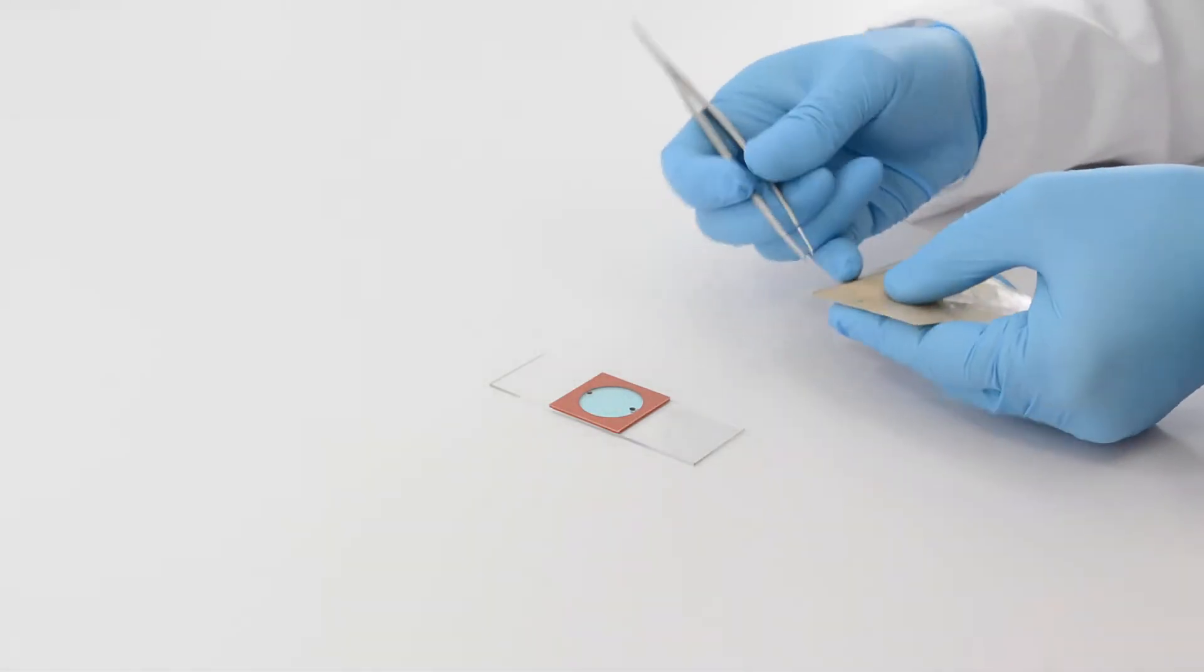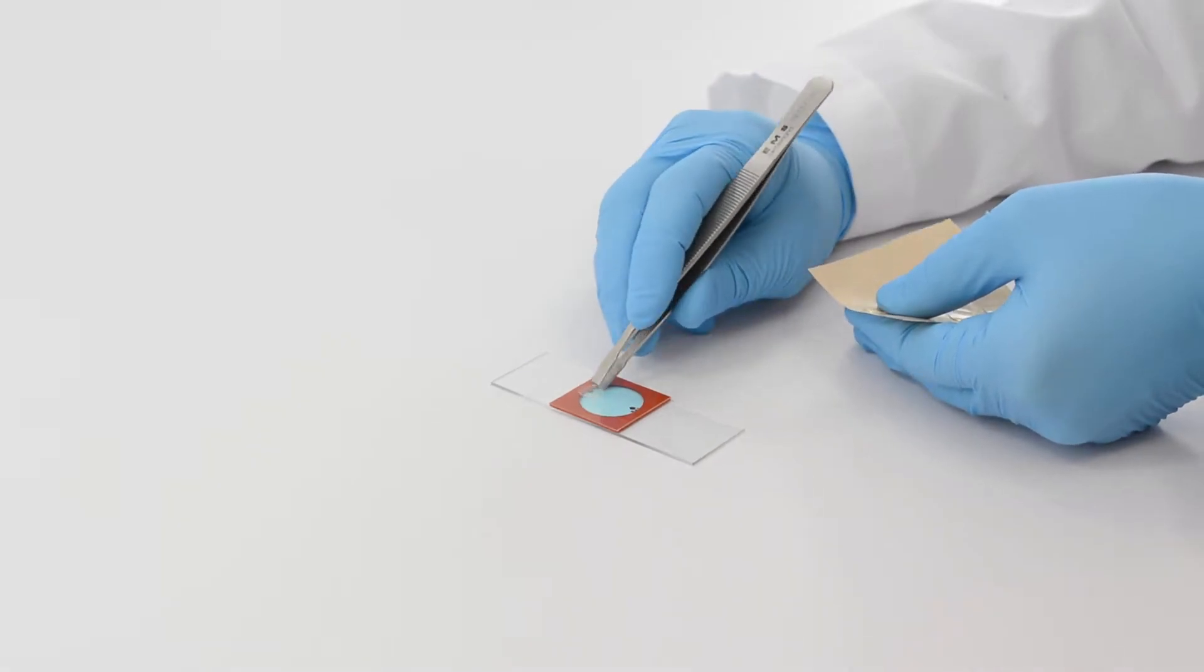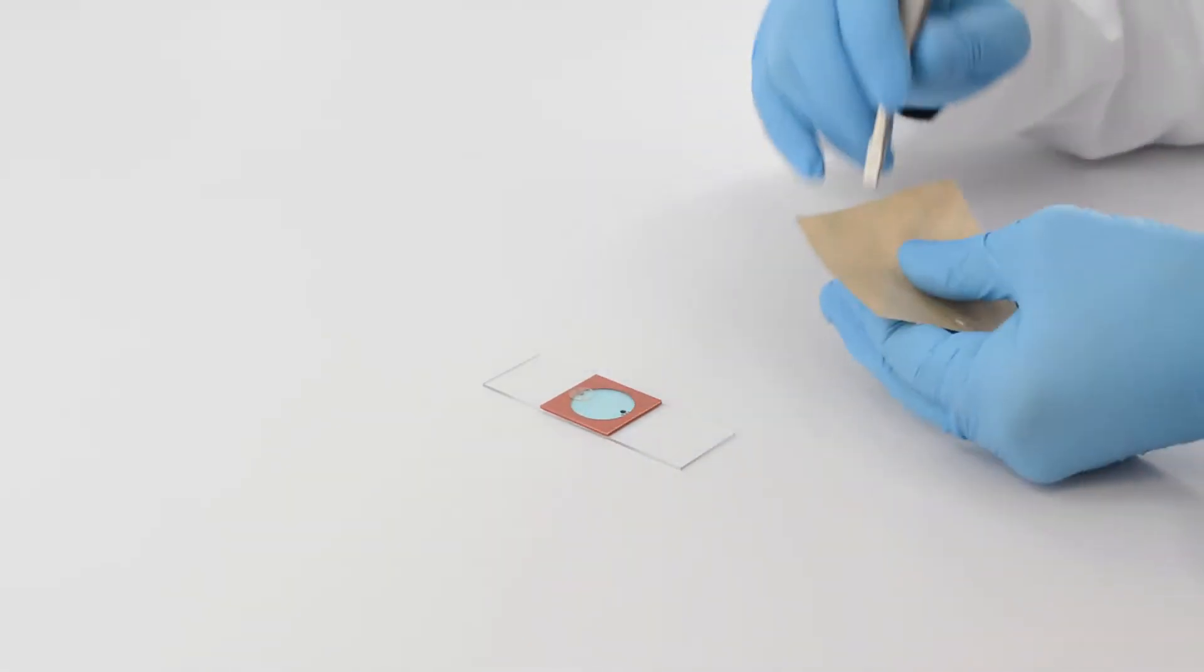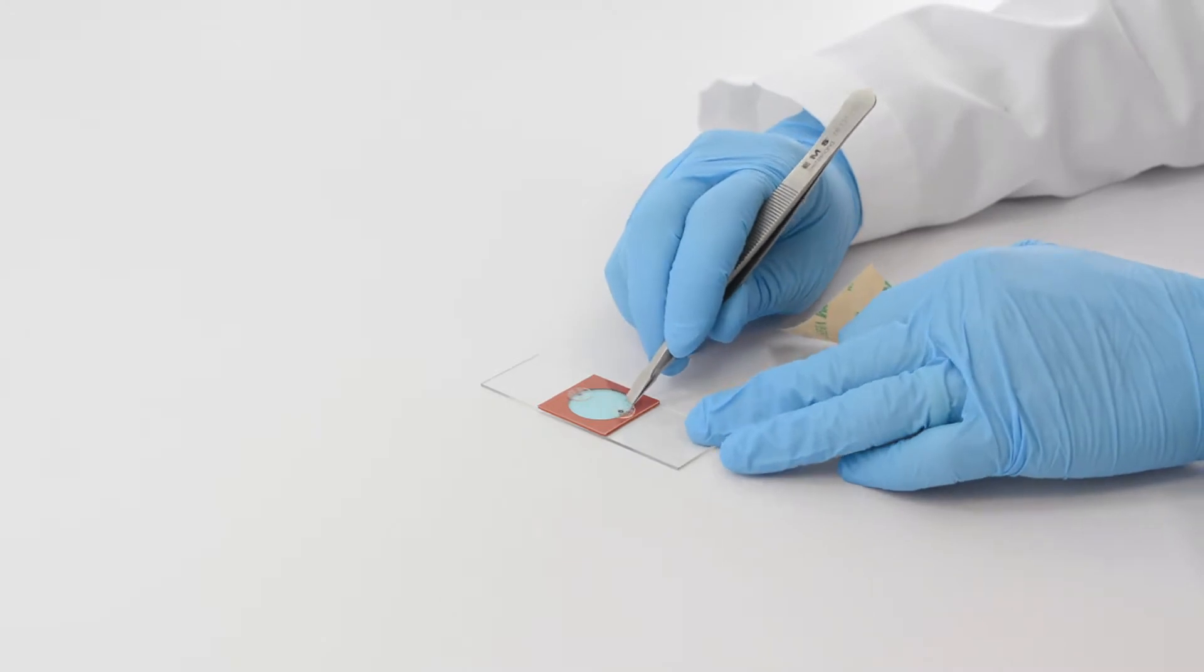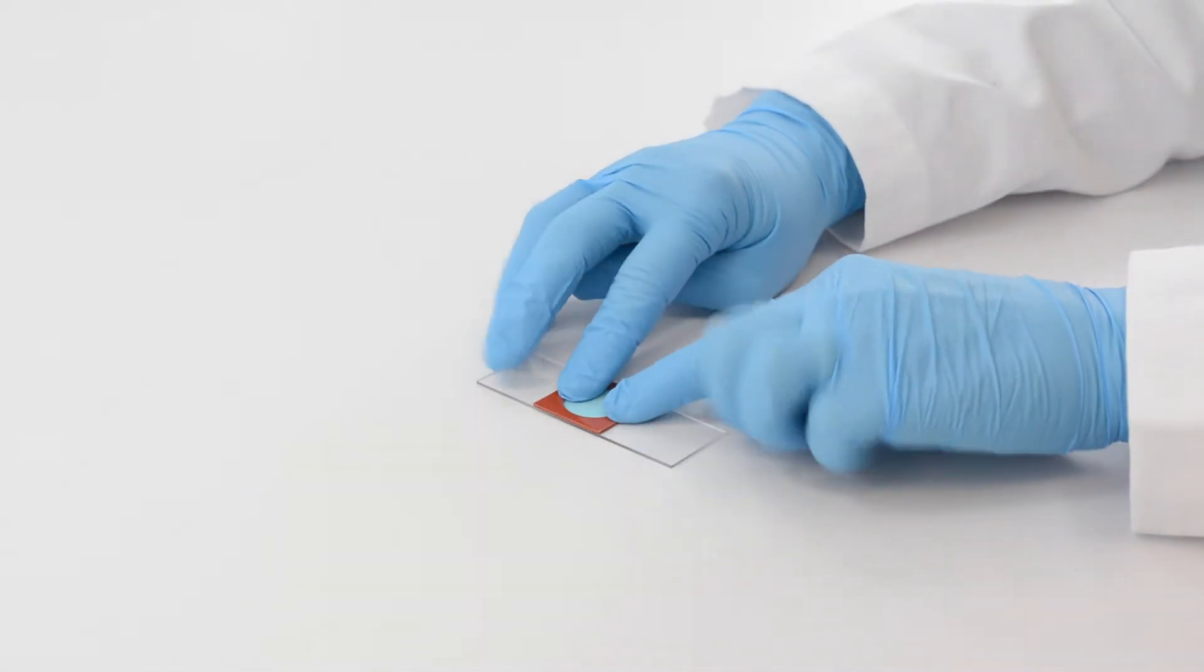Position seal tabs over the loading ports. Press firmly to seal.